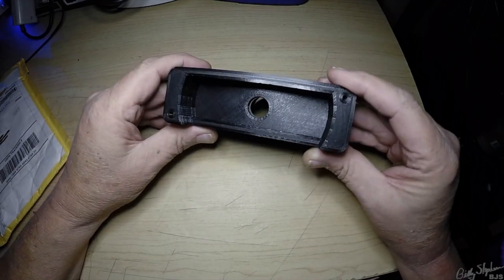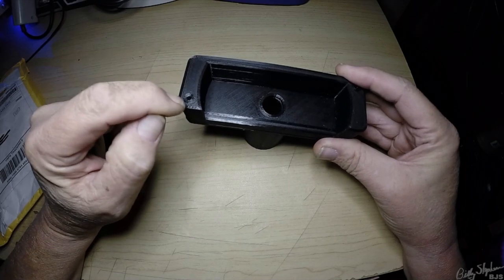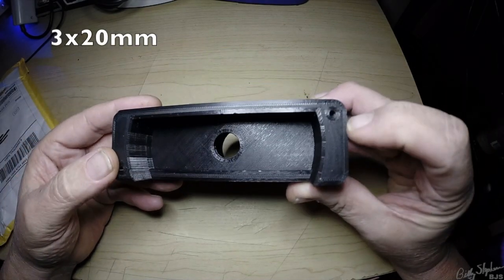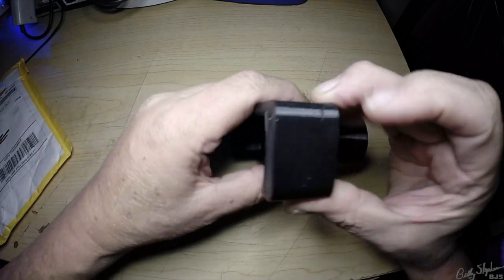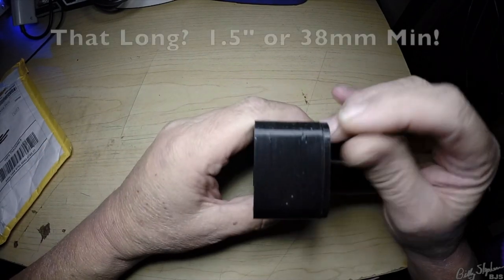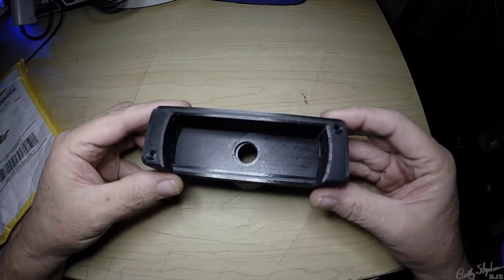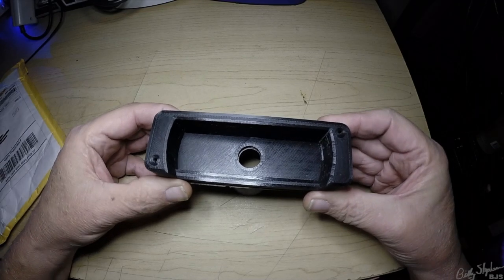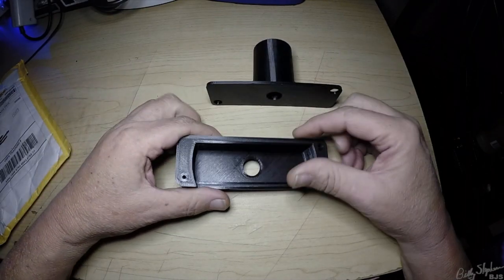Now what we've got to do is put it together. We've got to put a 4-40, about 0.112-inch diameter screw through there — it's got to be that long — with, I think, a wing nut. So that you can loosen this and then move it around to get the image directly, exactly centered with the camera.